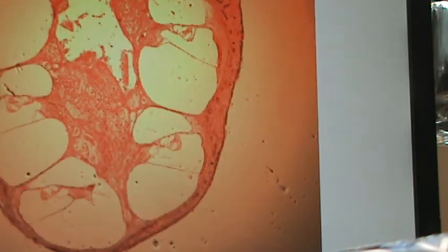Next. All right, and again, here's some tissue that you can look at. It's kind of interesting, and there's a lot of maybe epithelial tissue along the edge. It looks like some kind of, I don't know, simple squamous or something there. Okay, let's go on to another one. Oh, here's an interesting one. Let me zoom up a little bit. Maybe that'll make it easier to see. Go up a little bit.